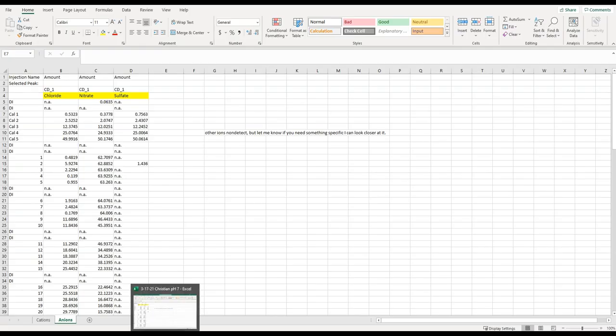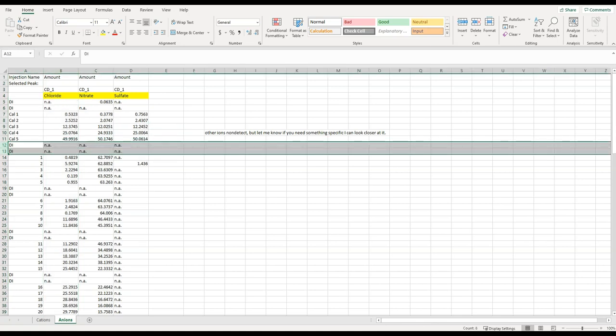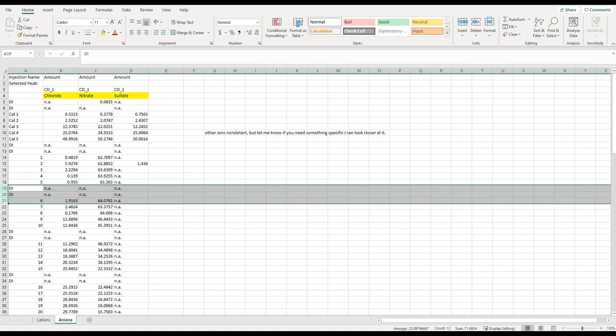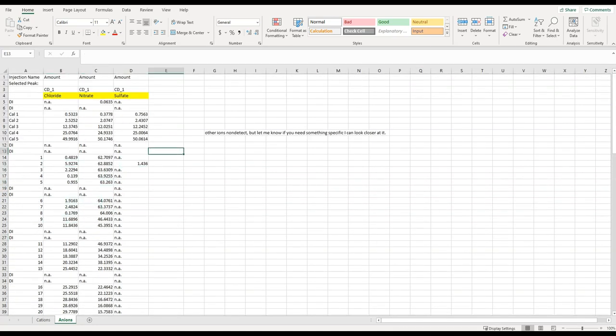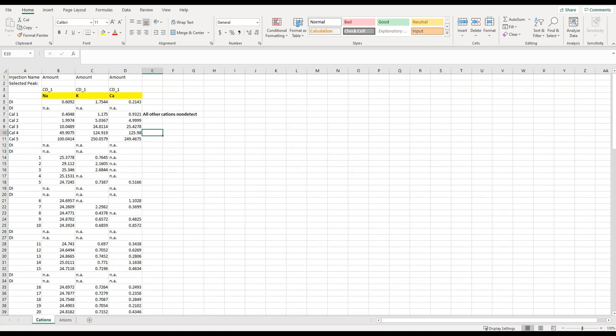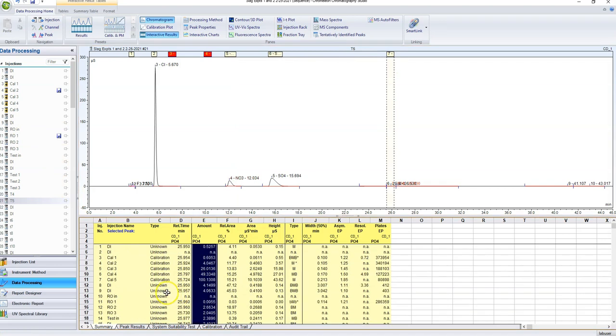So here's an example of an Excel file that I made for somebody else. So this is that sample column. He wanted chloride, nitrate, and sulfate, so I only copied those three columns. When you want to analyze your data, you can come in here and just delete out the DI waters, and then you're just left with all of your sample names and all of your concentrations in milligrams per liter. And I like to make one tab for anions and one for cations as well. So yeah, once you've done that, you've got all of your samples and all of your data in Excel, and you are ready to go.